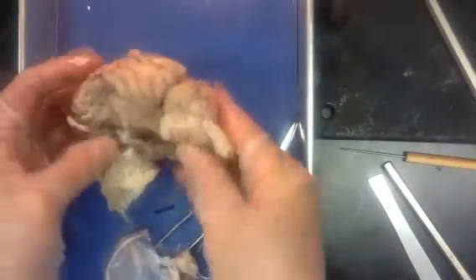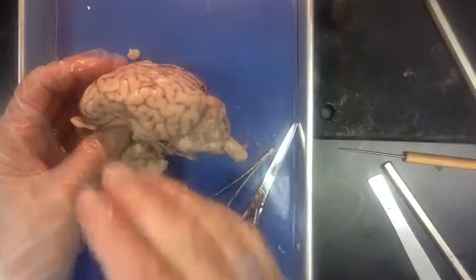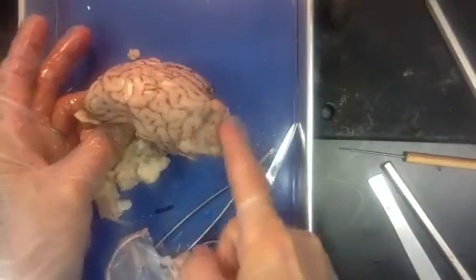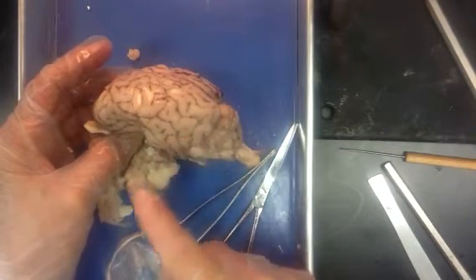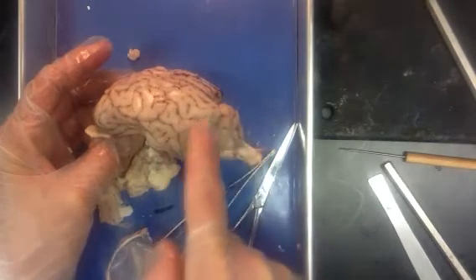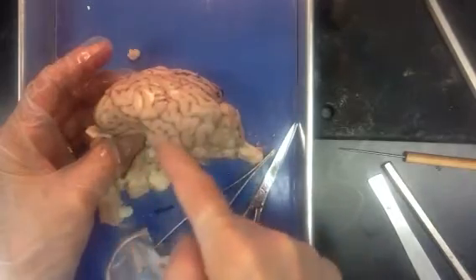If we look at the brain from a lateral view, you'll notice there's sort of a smaller brain and a larger brain. Now in the sheep, that larger brain isn't a whole lot larger, but in a human being it would be much more pronounced, and this smaller brain would be quite a bit smaller. Our general rule with Latin is, the longer the name, the tinier the structure. So the cerebellum is this small brain area. The cerebrum, which is the shorter name, is the much bigger, what we call the higher brain. This is where we have higher order functions going on.